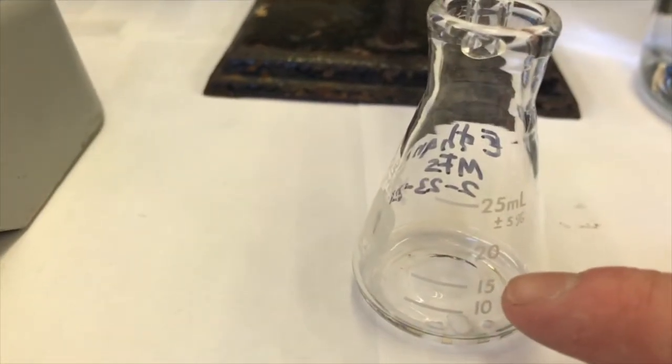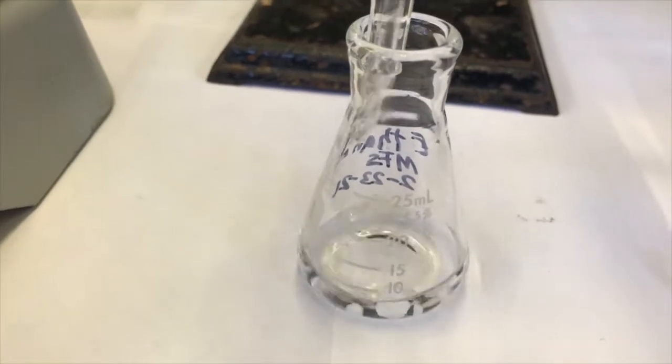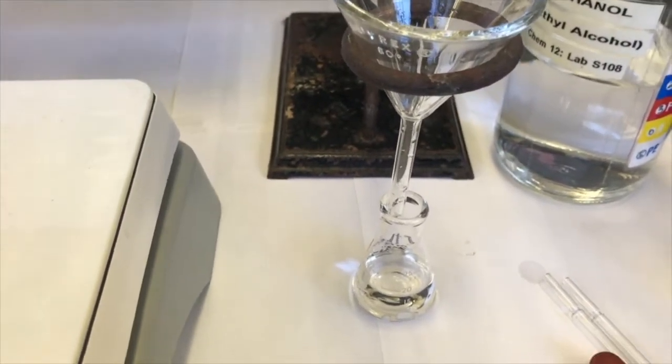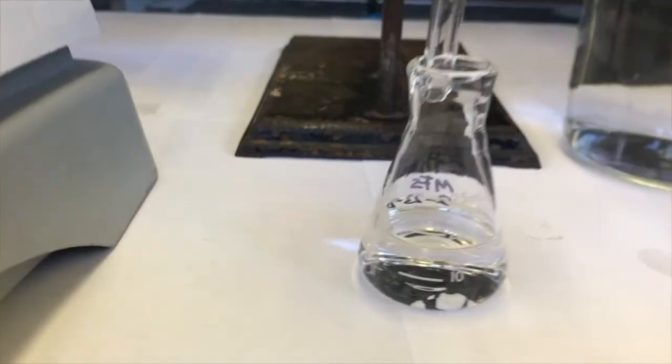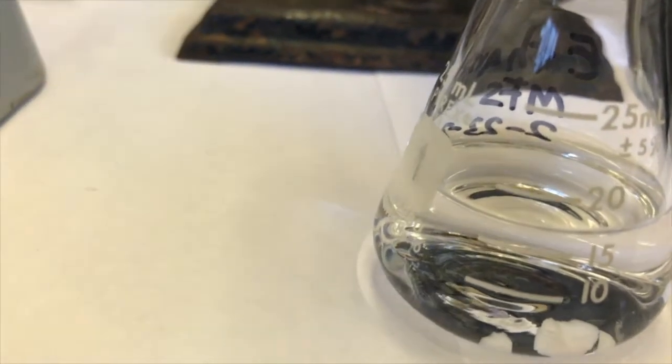So there's a line down here. That's the 15 milliliter line, if you see it. Yep, 15 milliliters. So let's see if I can do it. Pretty good. Just one little drop spilt. I could have been more fancy about it and used a glass stir rod to help with the drippage, but I knew ethanol is pretty viscous. It doesn't drip too much, and I only have one hand to do it because I'm using my phone to film the other hand. Okay, so yeah, we're a little bit over 15 milliliters, but that's fine. We're going to use the excess to help wash the mother liquor off our crystals as we filter them.